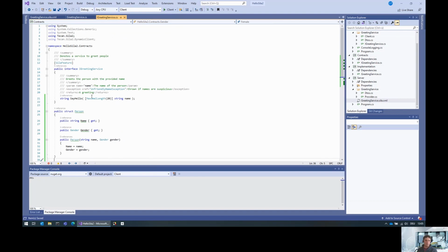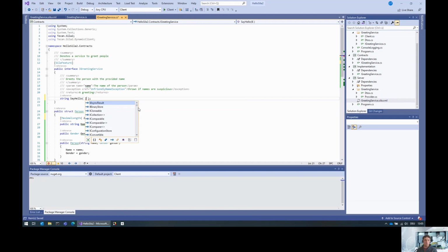We can also say the maximum length still applies to the name. And then usually we use a collection of person for this by default. But there are also a couple of other collection interfaces that you can use, for instance IList, IReadOnlyList. I think IEnumerable is also working. And this is the people to greet.